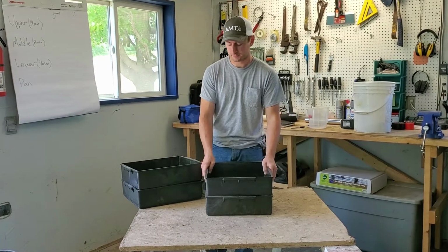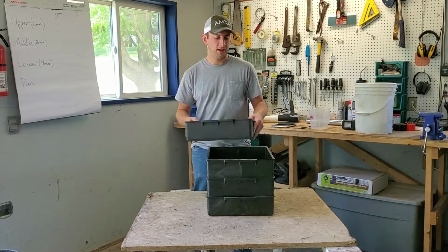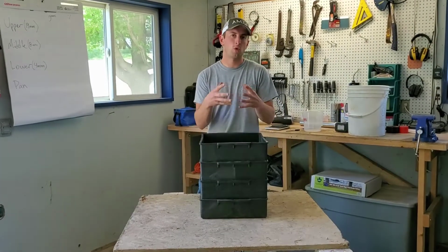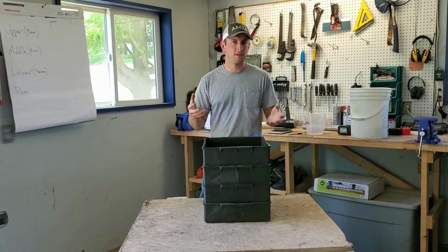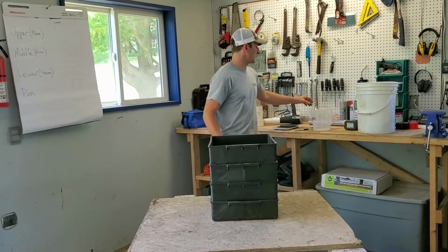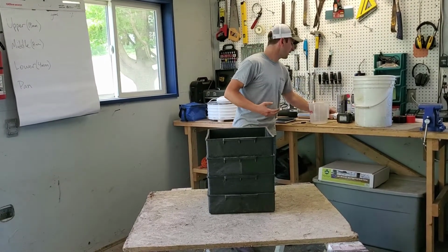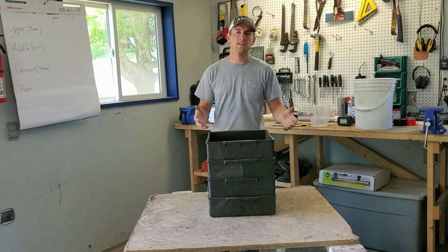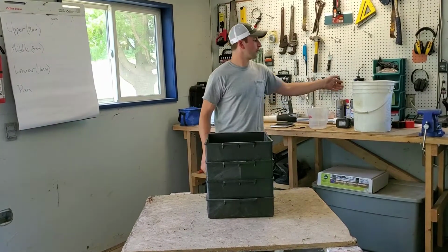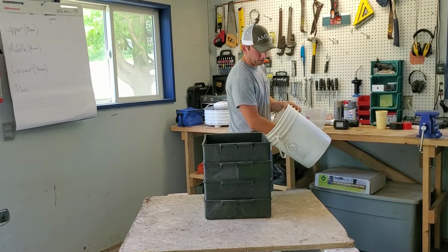So what we need to do is get a sample of our forage, and the forage should get as close as possible to the actual as-fed form, meaning you don't want a sampling device that makes very small particles, like a core sampler. Even a large core sampler like this can still reduce that PEF artificially, and so it may not reflect what the cows actually see. Today we're going to use corn silage. This is corn silage here, and it's actually quite a simple process.